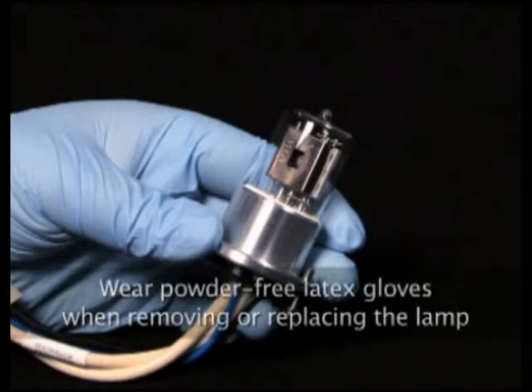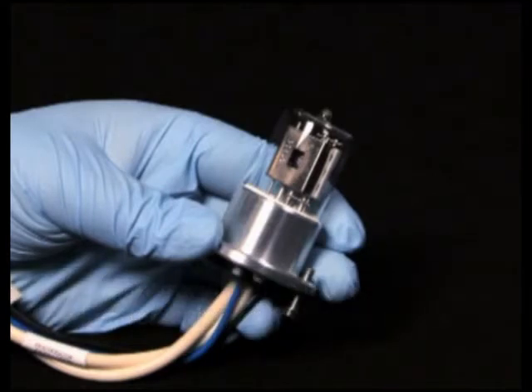To prevent lamp glass contamination, use powder-free latex gloves when removing or replacing the lamp. Do not touch the lamp glass while unpacking or inserting the lamp. Touching the lamp glass damages the lamp and reduces life expectancy.